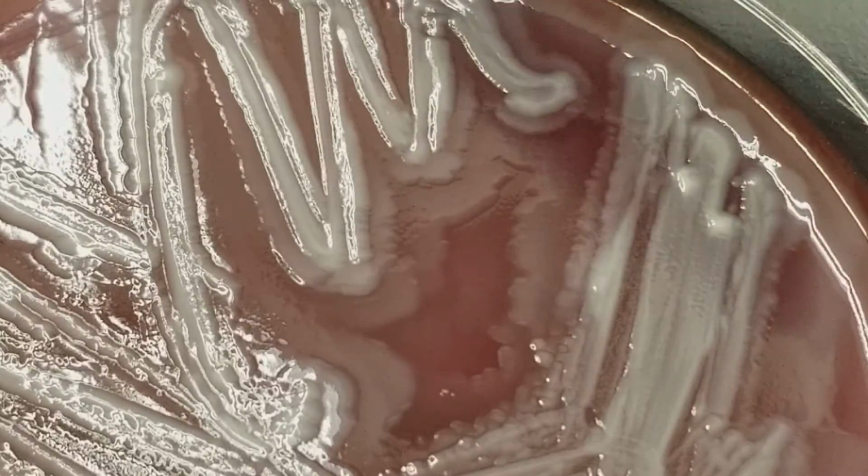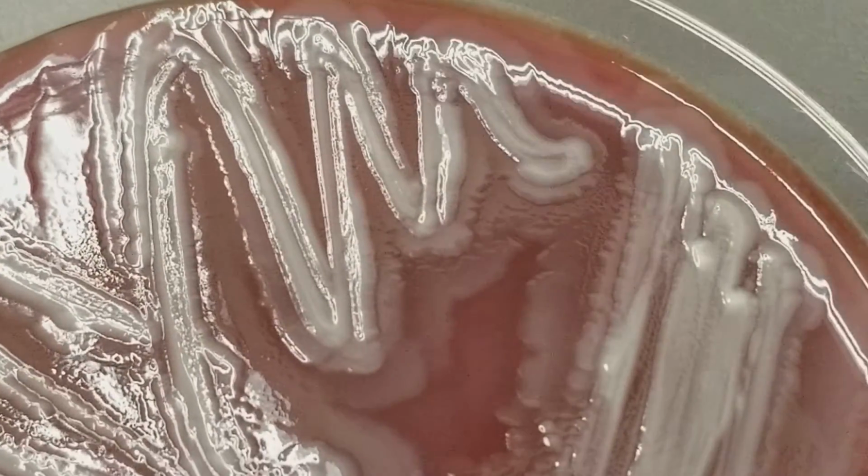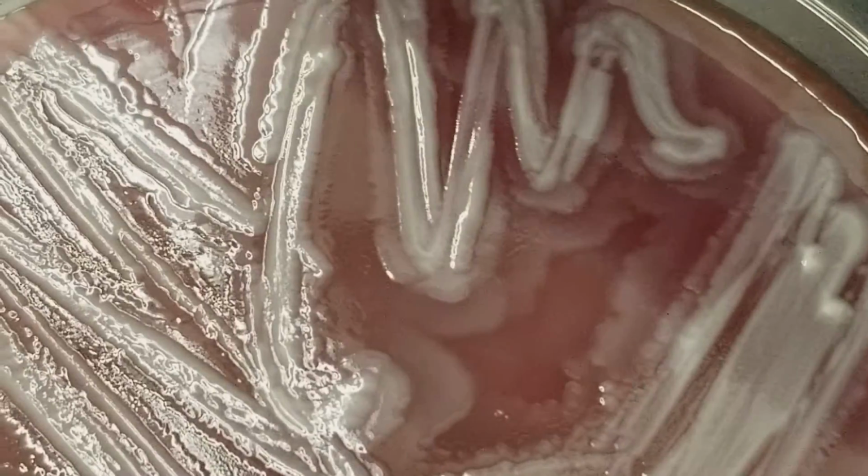And they also are rapid growers, okay? They divide very quickly. This is just gorgeous. I don't really want to take this off, but we've got to move on. So this obviously would take over the plate and just eat its way around the plate, and you could definitely tell that was a pathogen there.